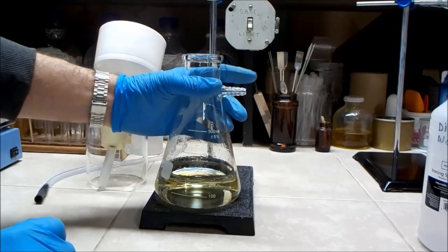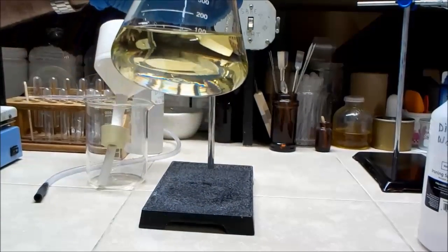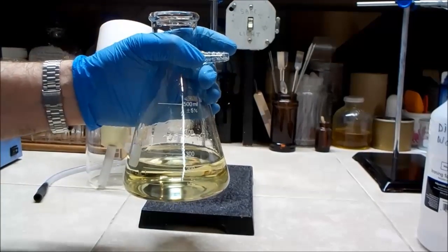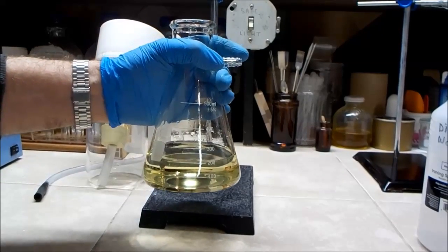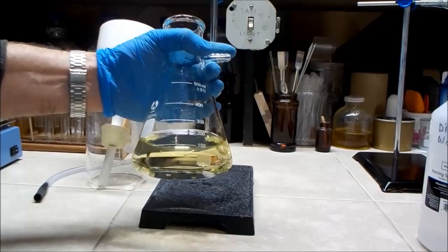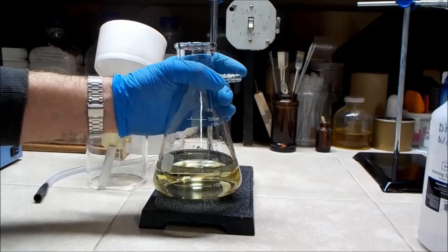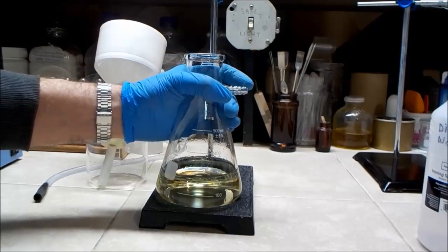Okay, so it looks like roughly 250 milliliters. And the clarity is very good. Slight yellow discoloration is probably from nitrogen dioxide dissolved, or possibly something from the dye of the drain cleaner, but I think it's the former. So the next step is going to be to determine the strength, and I'll do that by measuring its density, just like I did the sulfuric acid at the beginning.